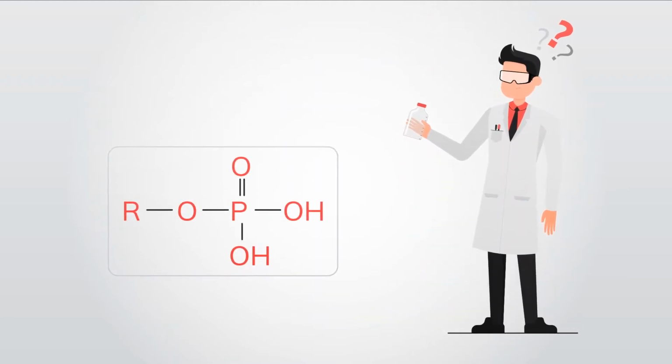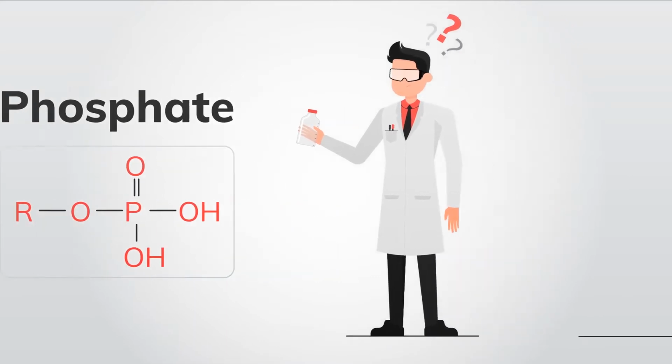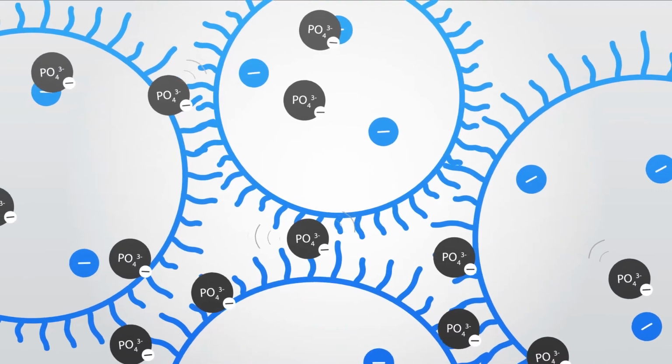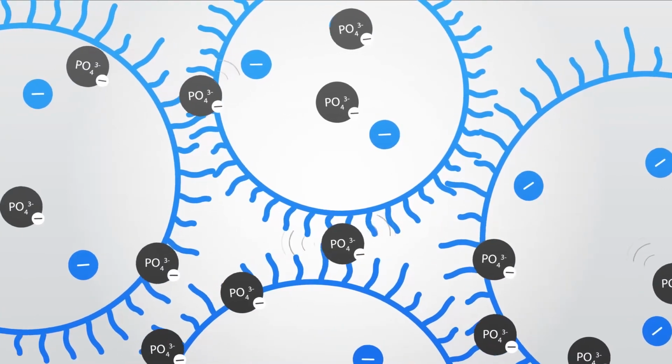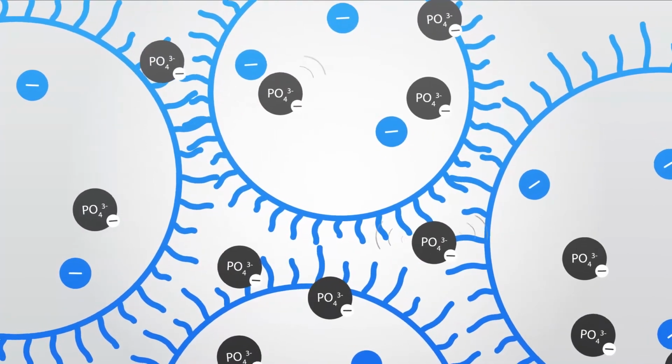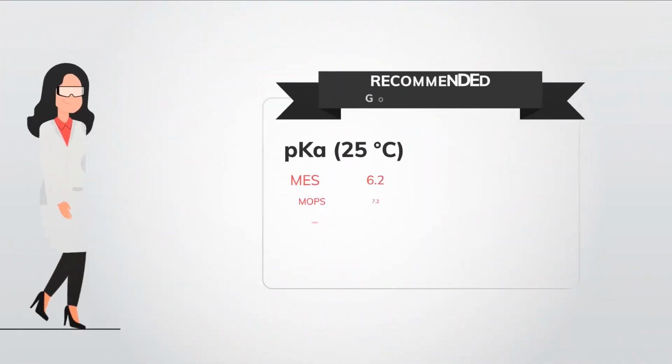So what happens when we select a buffer that's not ideal for the column, such as phosphate? The negatively charged phosphate is repelled from the negatively charged cationic stationary phase. Instead of buffering, it's kept at bay, and this can cause issues with method reproducibility.